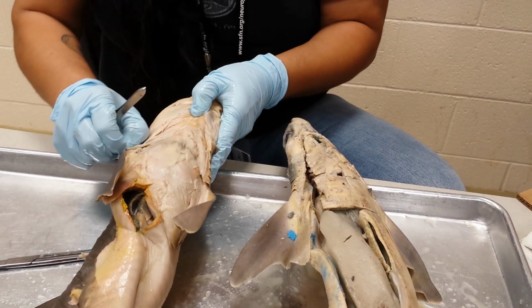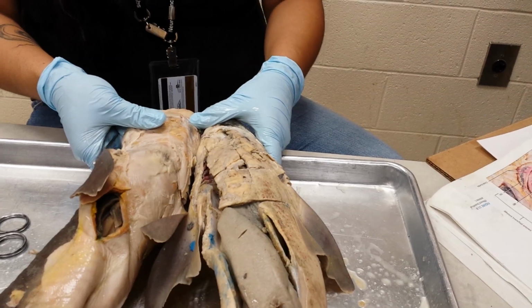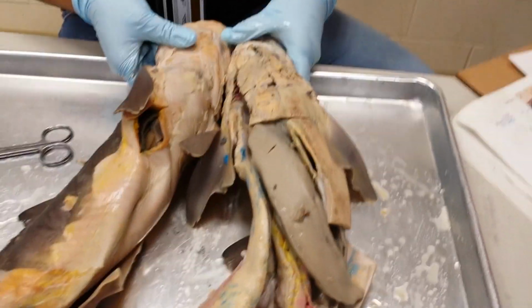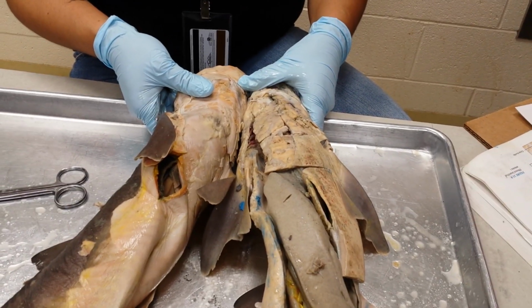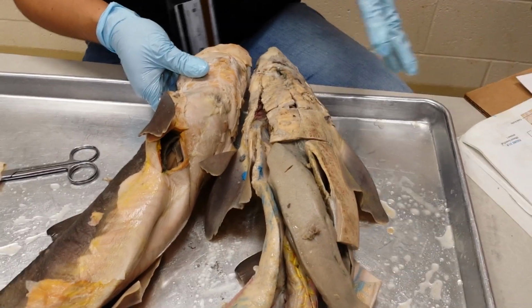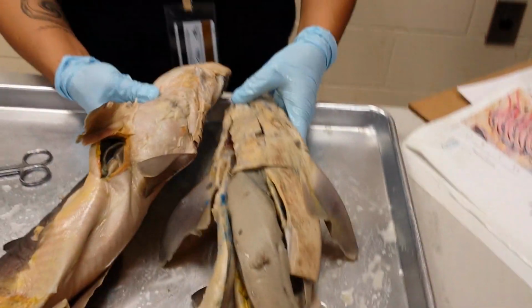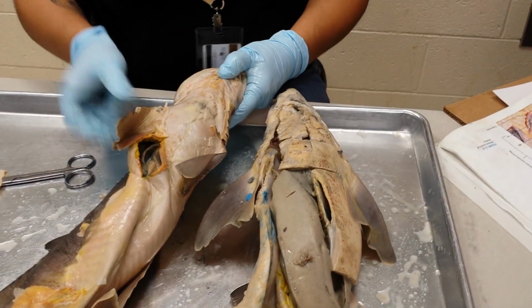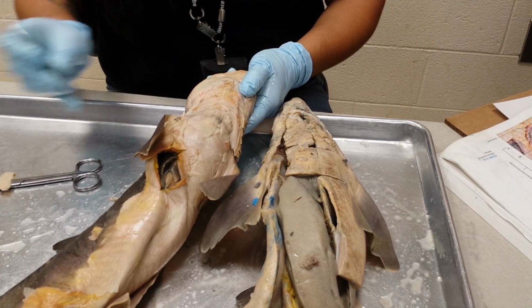Okay, those triangle muscles are the coracoarcuals. That's another difficult speller, coracoarcuals. There's a series of muscles that starts with coraco, but they have different endings. So this one is the coracoarcuals.